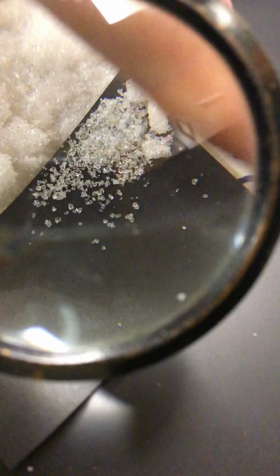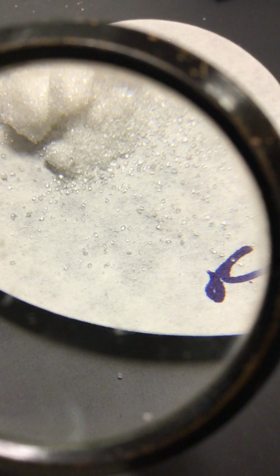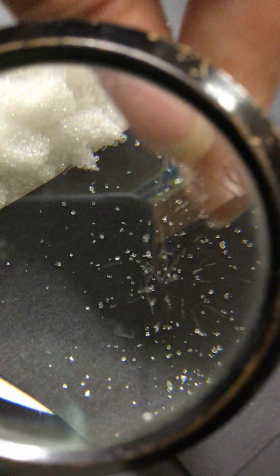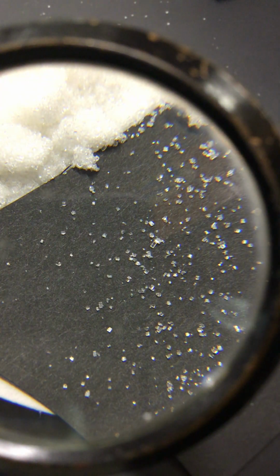After sodium chloride, our next substance is sucrose. Some of you might know this as table sugar. Getting sucrose ready. See if I can get the name in there. Sucrose. And here are some crystals of sucrose on the paper. Those are sucrose crystals. Again, it'd be fun to look at those.